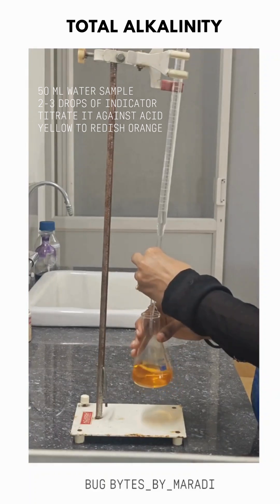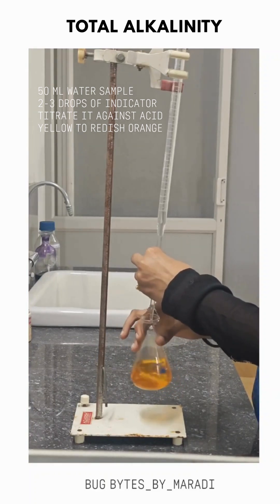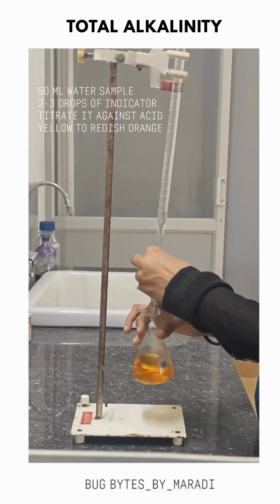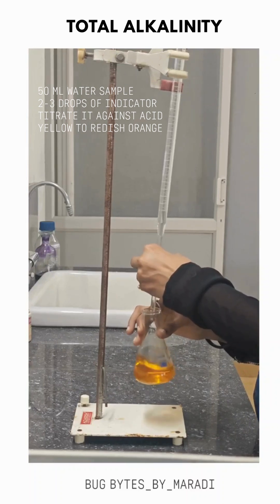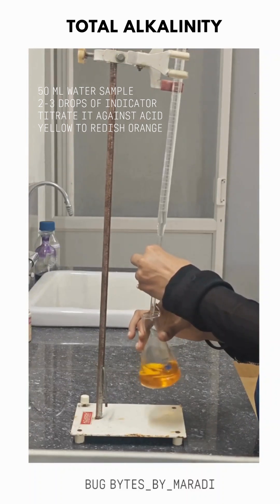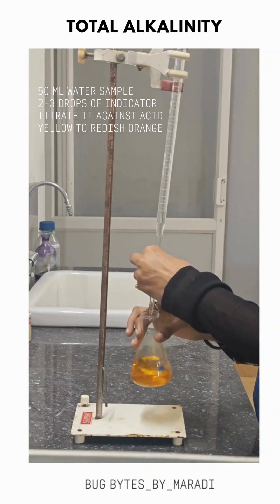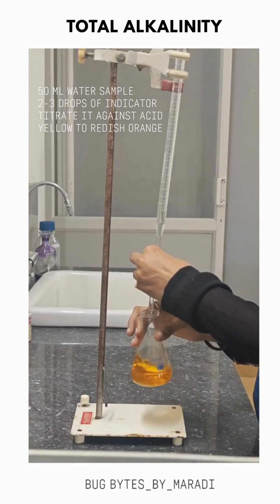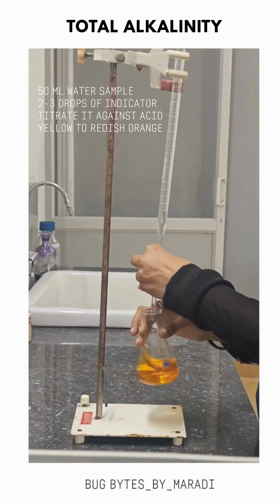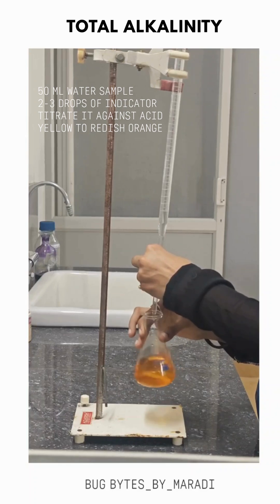To check total alkalinity, take 50 ml of water sample and add 2 to 3 drops of methyl orange indicator. In basic conditions it turns yellow in color. Titrate against 0.1 normal HCl or sulfuric acid until it turns into a reddish-orange color — that is the end point.